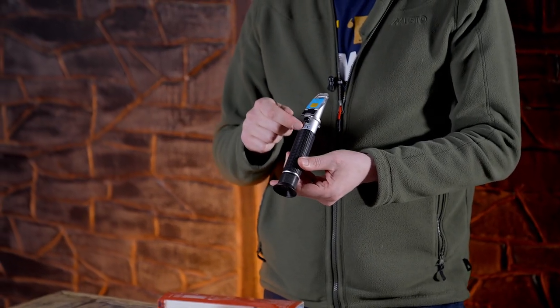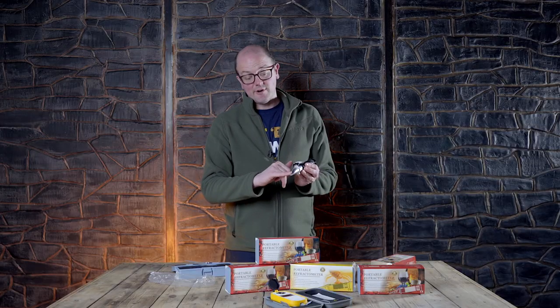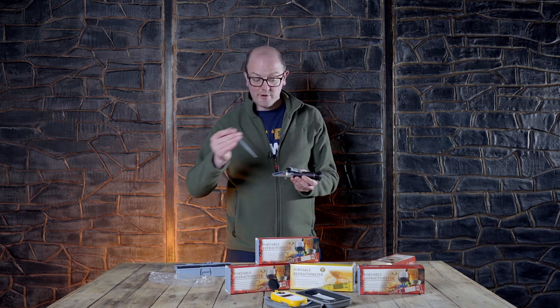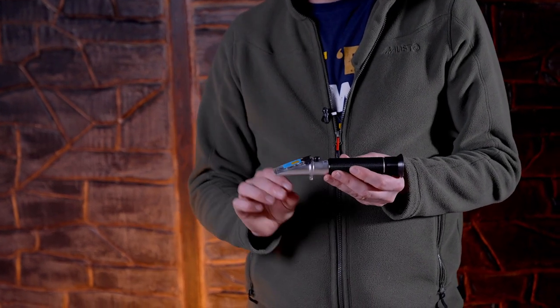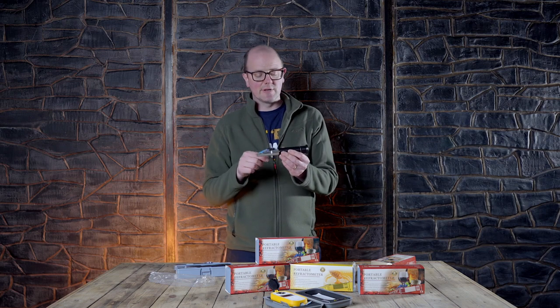If it says ATC on it, it means automatic temperature correction. You take this off, make sure it's clean — clean it with distilled water so you're getting an accurate reading. You take a few droplets and place them onto the reading window, then pop this over the top. That allows you to push the power button on the LED one and it back-lights the reading.